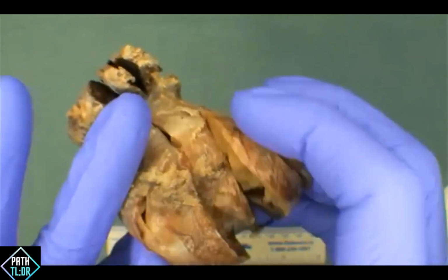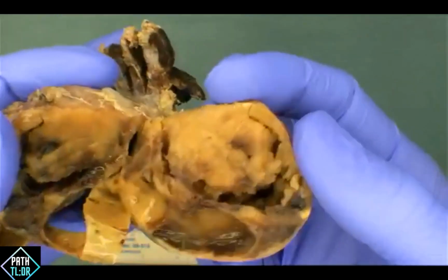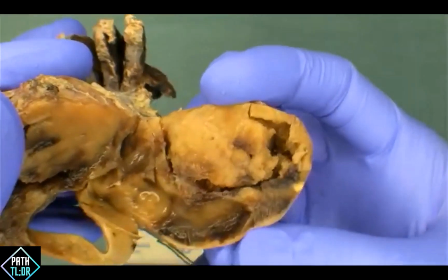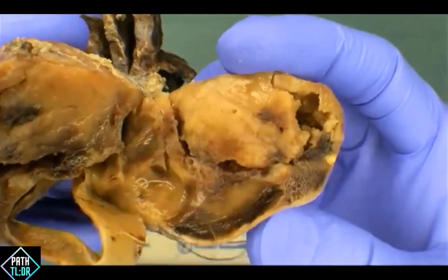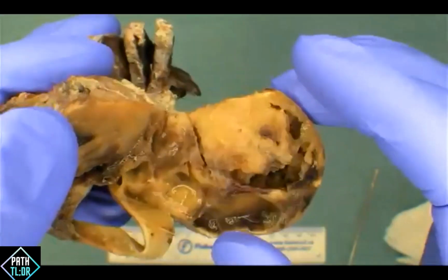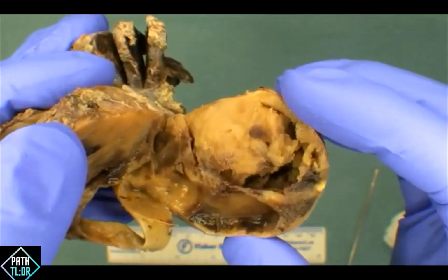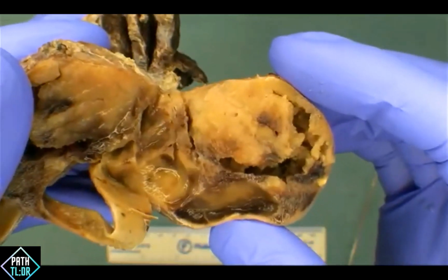Okay. So we're not sure what this is, but I think to a point earlier in the chat, what are the important features in terms of sampling for this lesion? Yeah, exactly. Looking at the periphery of the nodule here in its entirety histologically to see any evidence that this is something more than just a goiter.